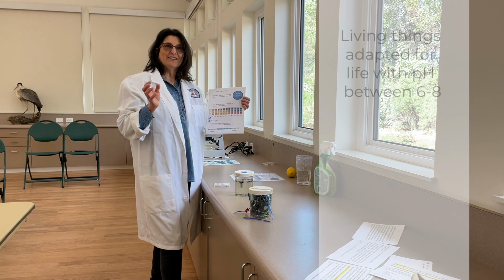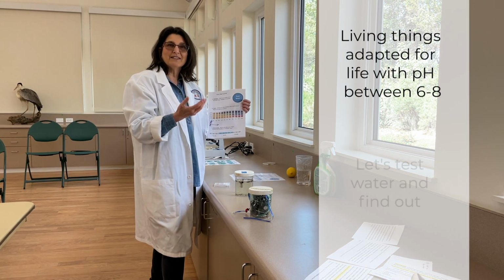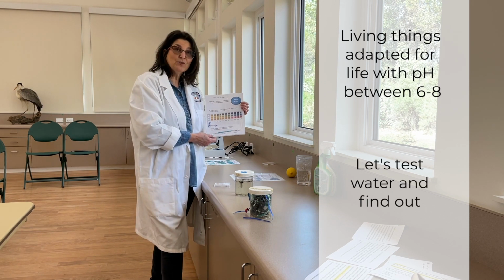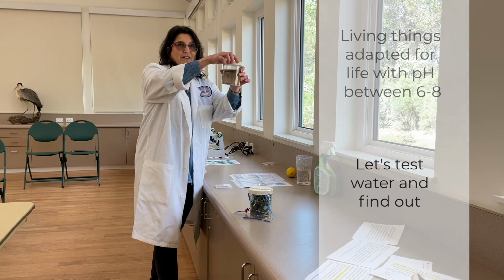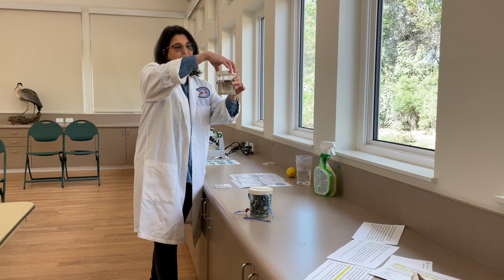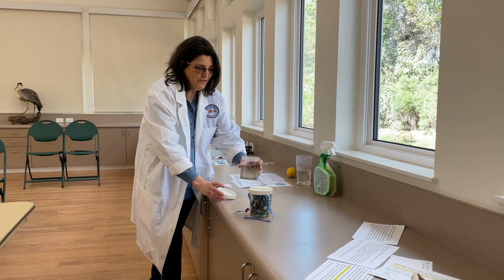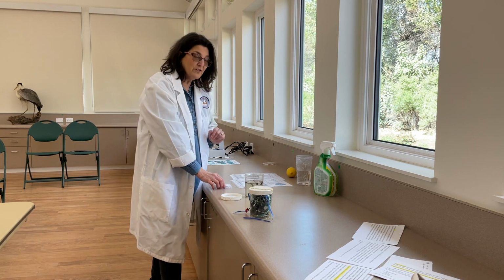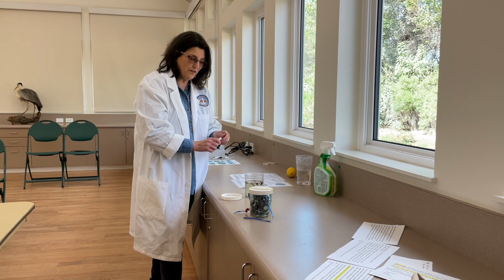So living things are adapted for life at a pH from between 6 and 8, give or take. So today we're going to test the water and find out. Remember this sample that I took at the pond? We're going to see if this is healthy or unhealthy for wildlife. So remember, I asked you to make a prediction. I want you to think about that. Did you think this is healthy for wildlife or unhealthy?